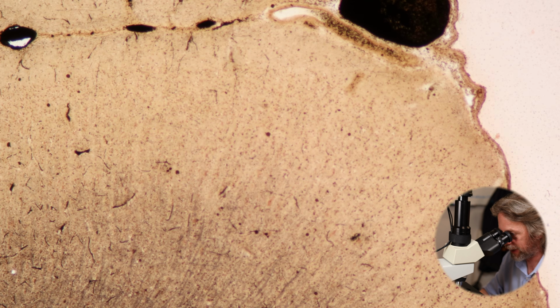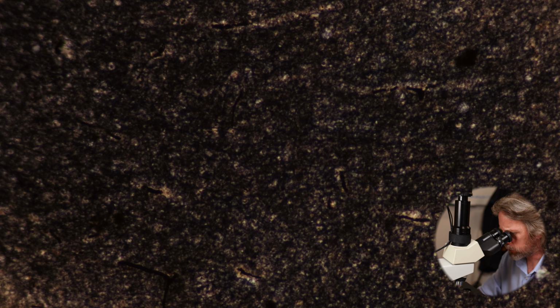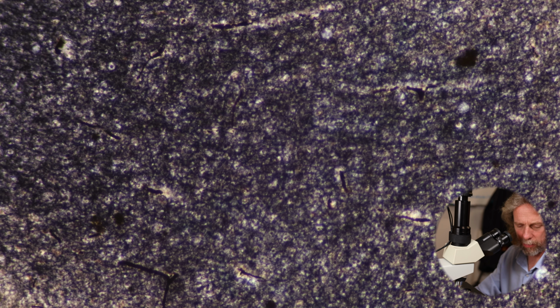What we're seeing there is the neuron cell bodies in the grey matter sending their axons in towards the white matter, and you can see that process of myelination. And then as those axons all get packed together, that density of the stain gets really dark. Oh, very cool. Right, if I go to a higher power, I've got a good chance of being in focus. That's pitch black. Right. Super black.